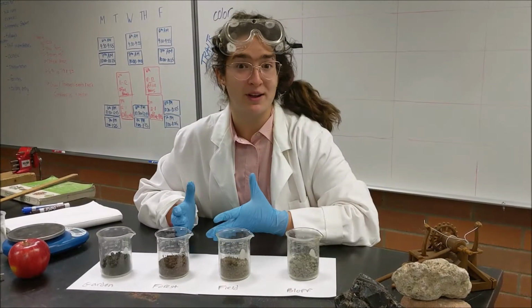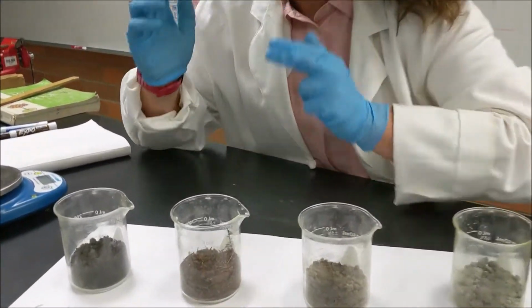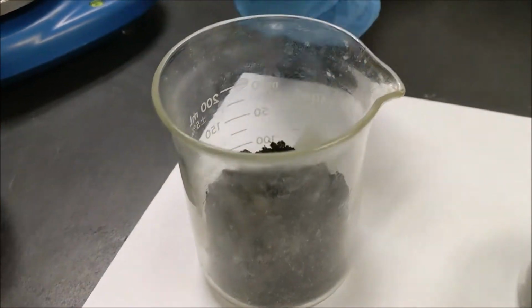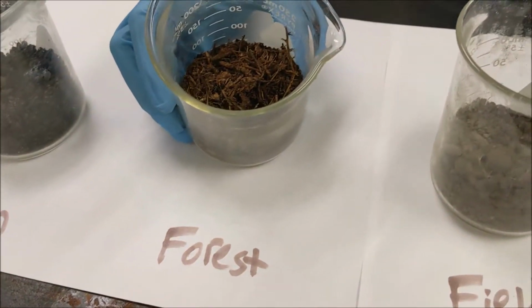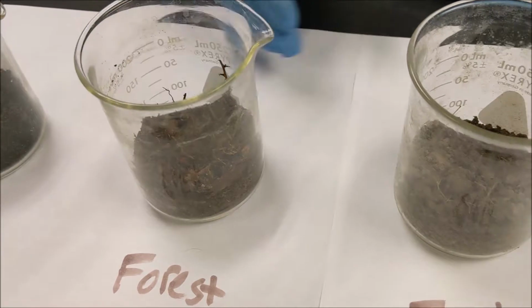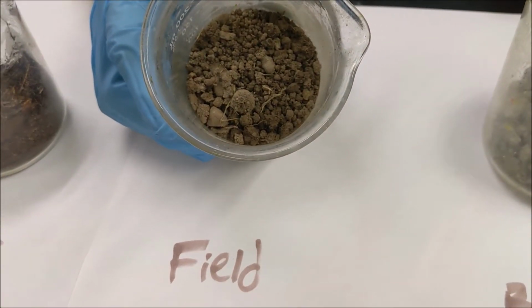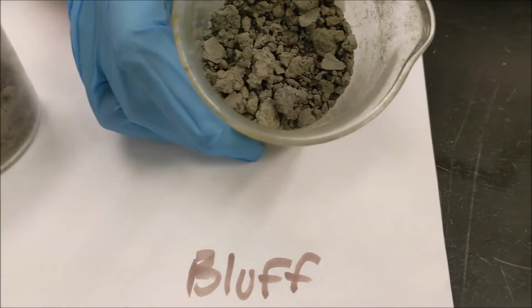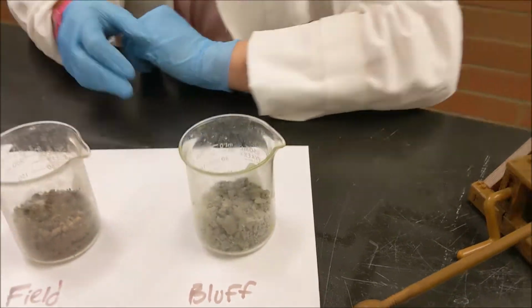The first physical property that we're going to look at is color, so let's take a closer look here. The garden soil appears to be kind of a dark brown, and the forest soil, by comparison, is a bit more reddish, kind of a dark red-brown. The field soil, I would say maybe a medium tan color, and the bluff material, probably a light gray. So let's write that down in our chart.